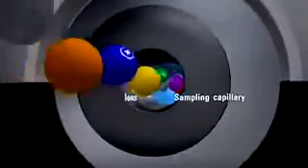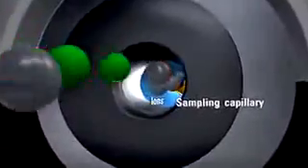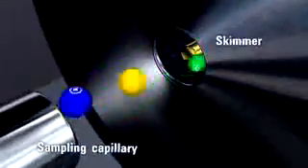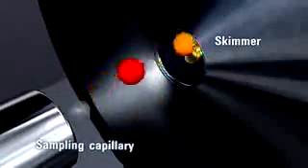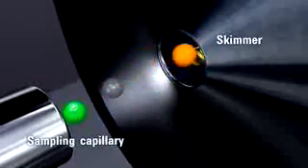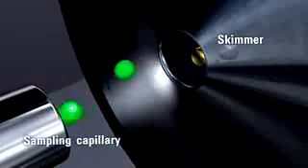High volume counterflow drying gas reduces noise related to incomplete drying of solvent droplets and keeps the sampling capillary and ion optics cleaner for reduced maintenance. A thin skimmer aperture, carefully matched hole size, and short capillary-to-skimmer distance reduce beam broadening.